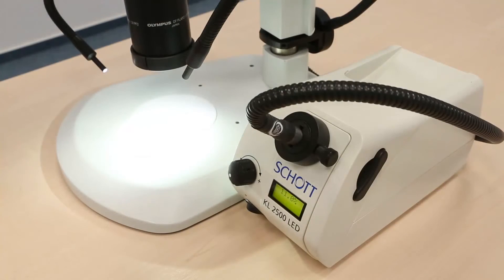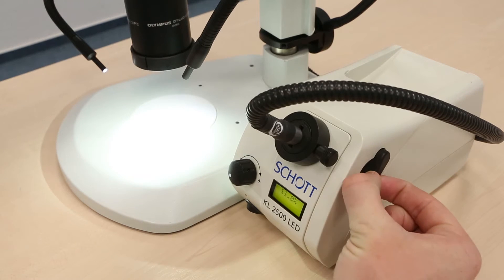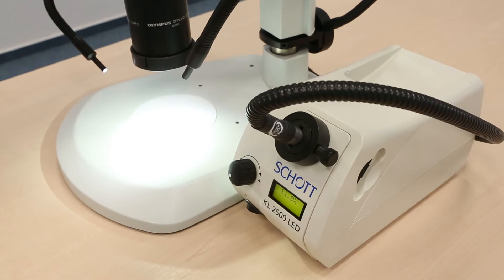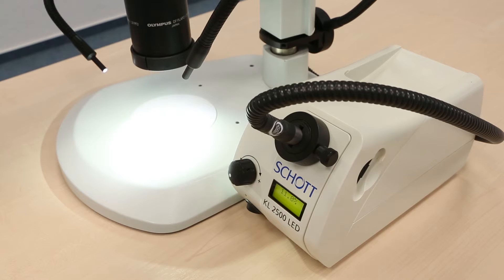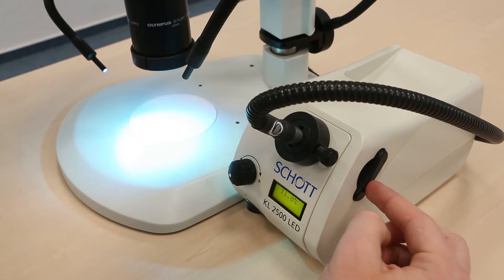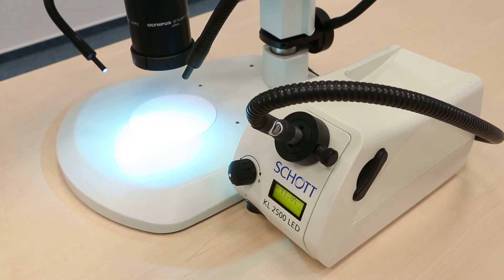In addition to what I have just demonstrated, this product also has a filter slider which enables you to adjust the light and change it into many different colors. For the sake of this demonstration I am now going to insert a blue filter slider. Here you see the light has now changed to a blue color.